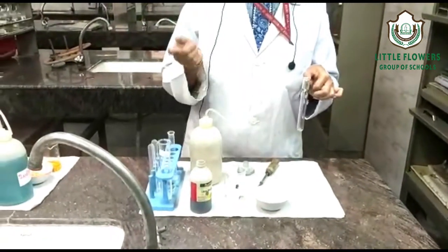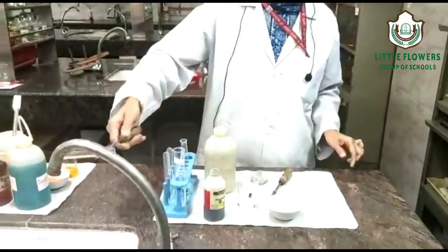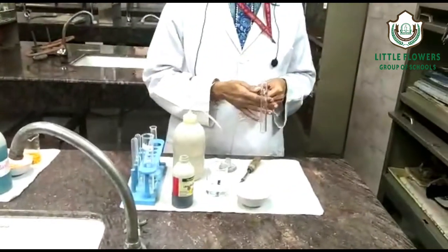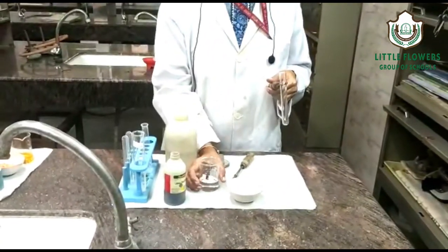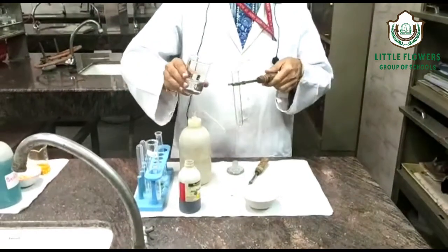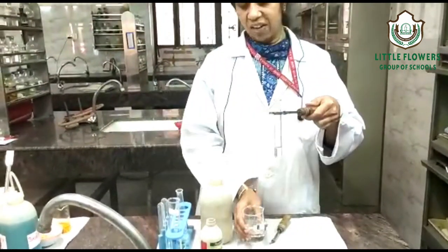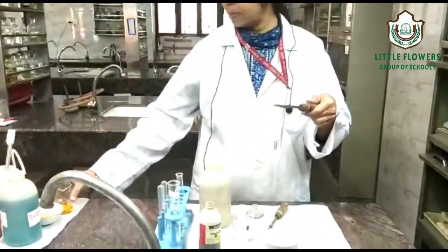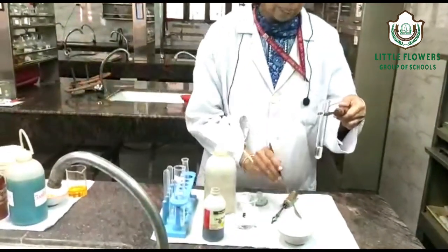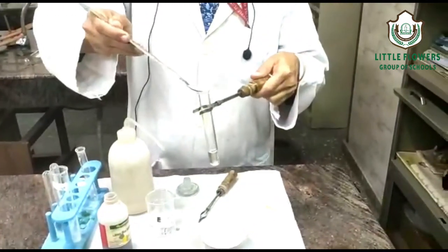So we are assuming a carboxylic functional group is present. For the carboxylic functional group, we will be doing the sodium bicarbonate test. We take the organic compound in a test tube — say 5 ml — and add a little amount of sodium bicarbonate.